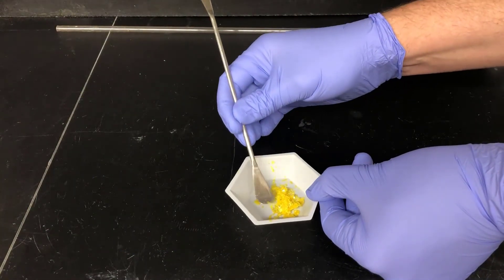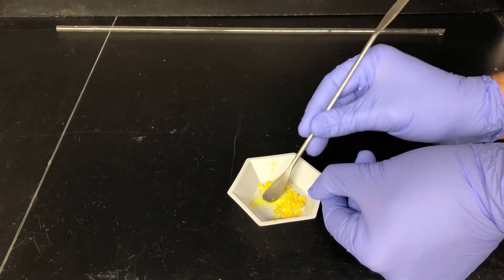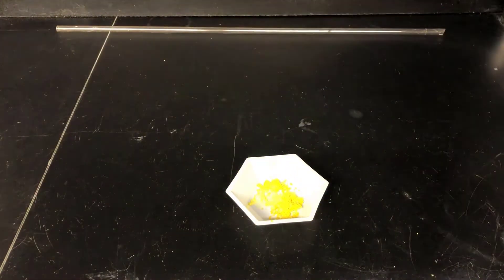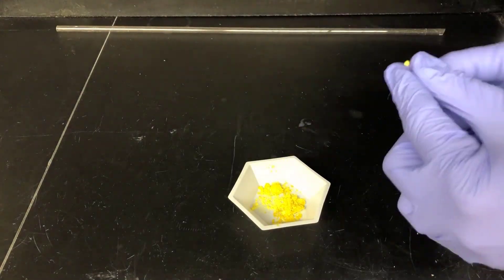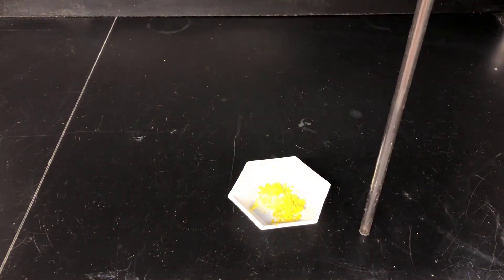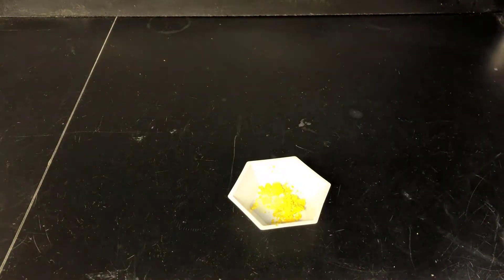Finally, I'll prepare a sample for melting point analysis by crushing some of the crystals to make it easier to pack them into the melting point capillary. Here I'm using a spatula to crush the crystals into a powder. Next, I'm taking a melting point capillary tube and pushing the open end into the powder to get it into the tube, then turning the tube over and bouncing it on the bench to move the solid down into the closed end. To help with the packing, I'll bounce the capillary through a long glass tube a couple of times. Now the sample is ready for melting point analysis.